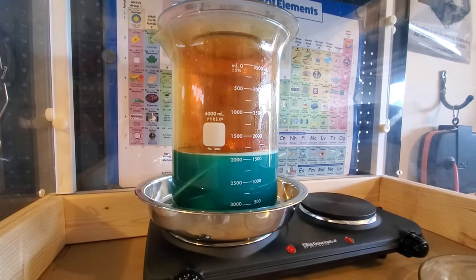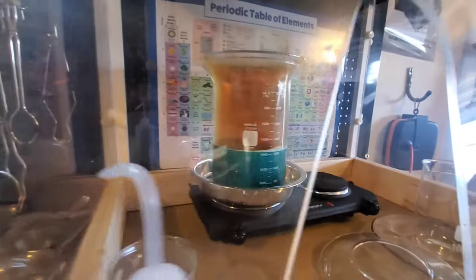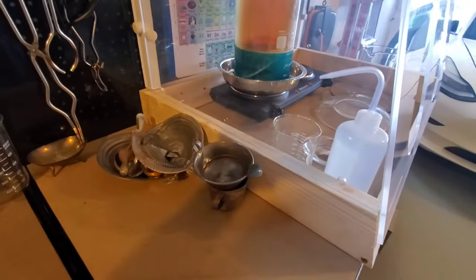All right. We're about 4 hours into the refining process now. And I'm about halfway through my silver lot. Here's what you can see remaining.